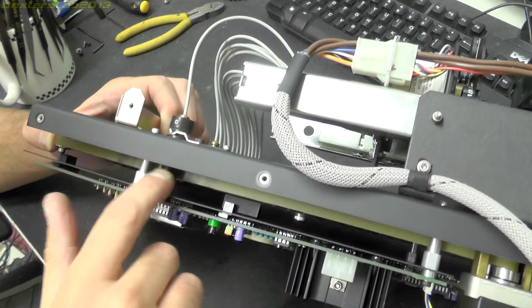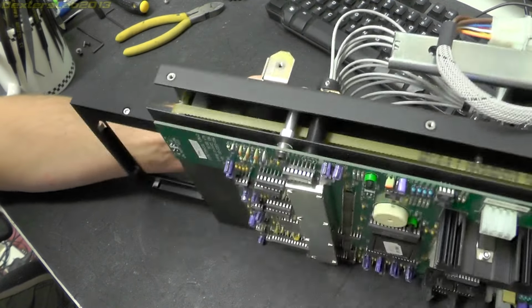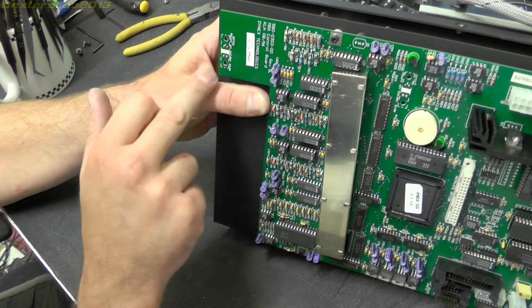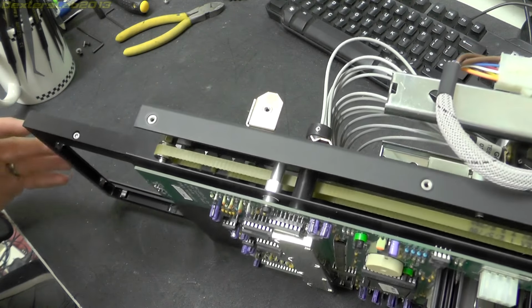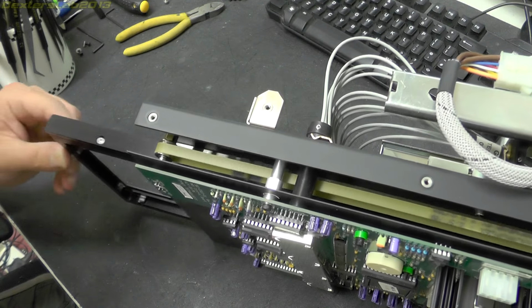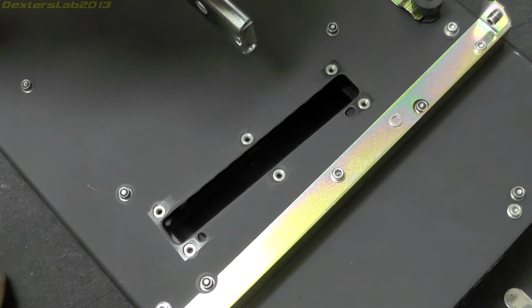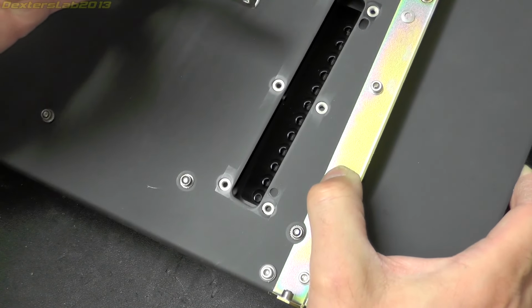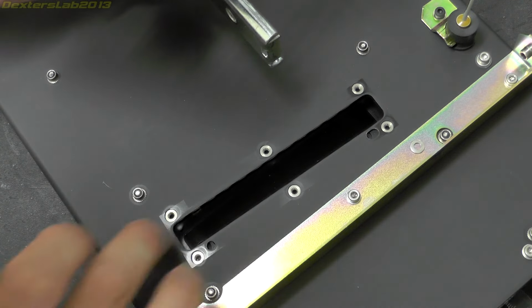And just down in there you can see the drive belt, which comes off this stepper motor here to extend out the microplate tray mounted on the underneath of this PCB. There's a couple of optical sensors, and there's a small section of metal on the tray which just breaks the beam, so the system knows exactly where the tray is, or at least that it's at one extent or the other. Okay, there we have the assembly where all these optical fibres come in and then shine through upwards, and hopefully you can see there the underside of those photodiodes. There does appear to be a lens arrangement in between, but generally that just goes straight through.